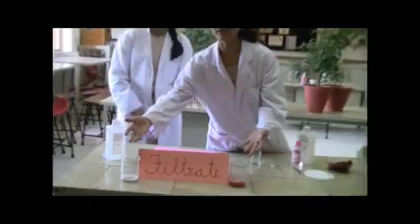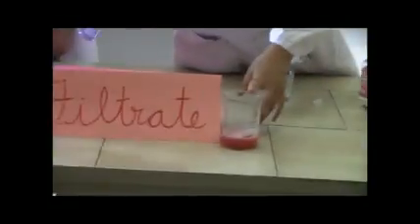What we obtained are filtrates of banana and strawberry. Now we're going to be forming precipitates. For that, you take a small glass if you're doing it at home and pour the filtrate, the strawberry, into it about halfway. I will be pouring my filtrate into a petri dish.